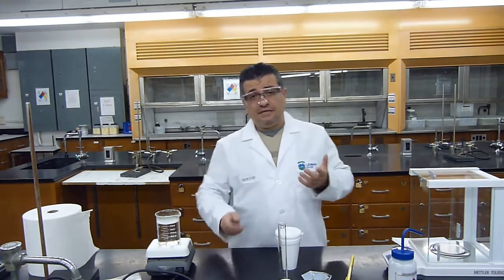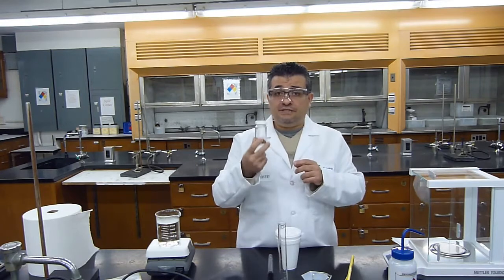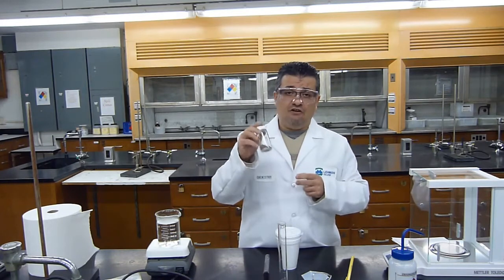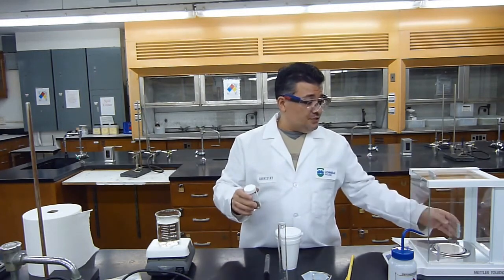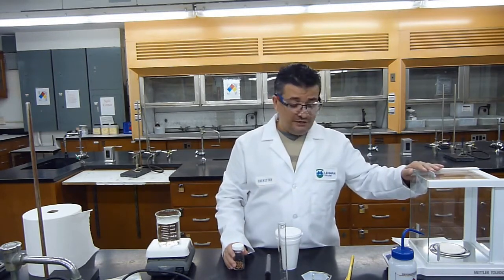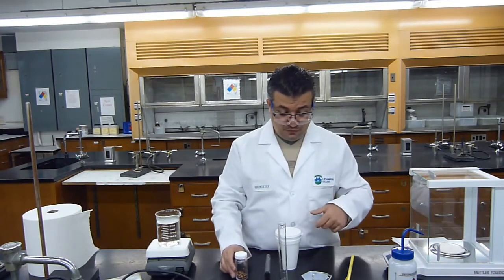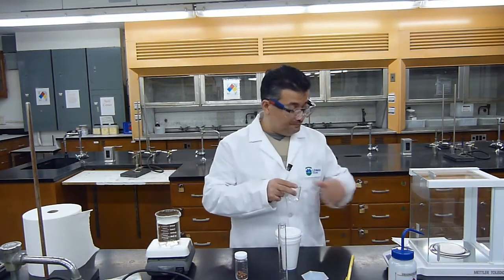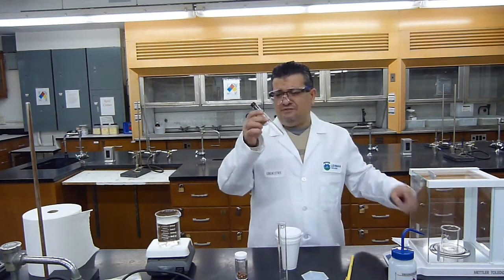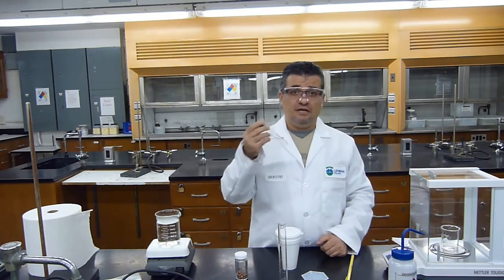Okay. The first thing that I'm going to do is obtain my unknown metal. This is a quantitative experiment, so I really need to measure the mass of my metal very well. Just like you have in your labs an analytical balance, I have an analytical balance right here, and I will weigh this metal to 4 decimal places. So what I will do is put a beaker inside, because I really need to measure the mass of the test tube and the rubber stopper empty.